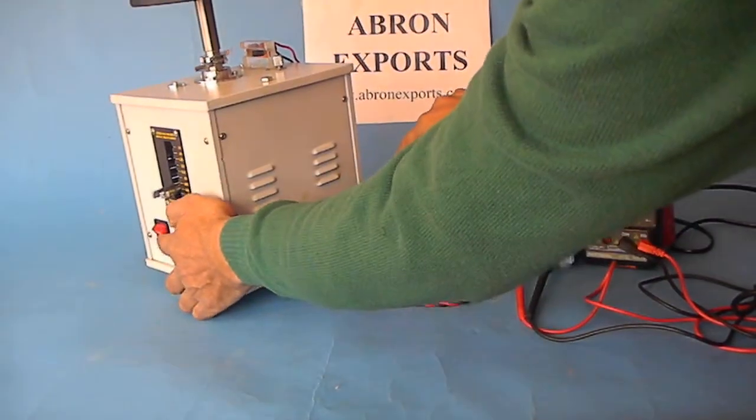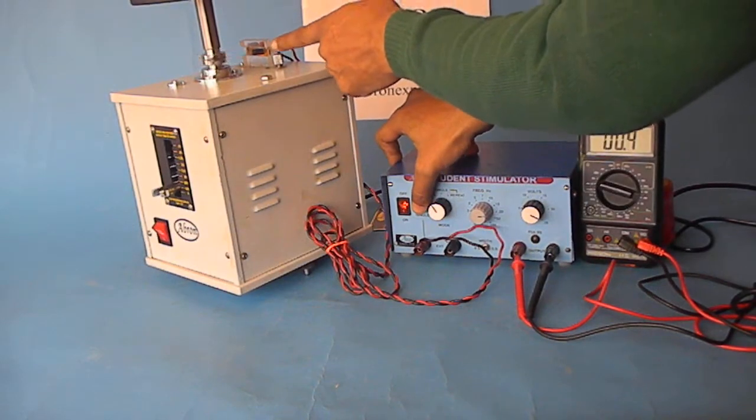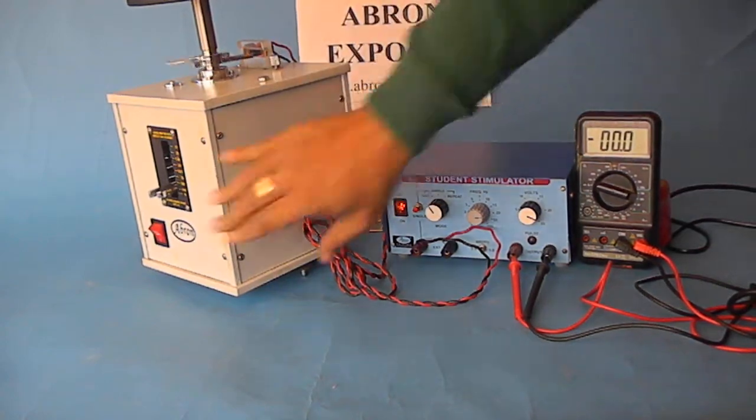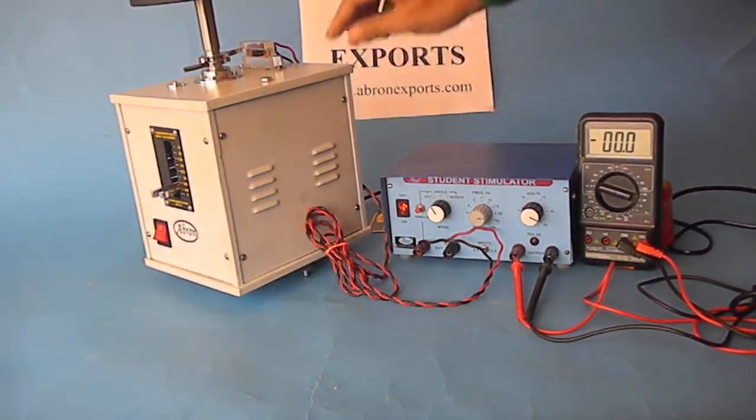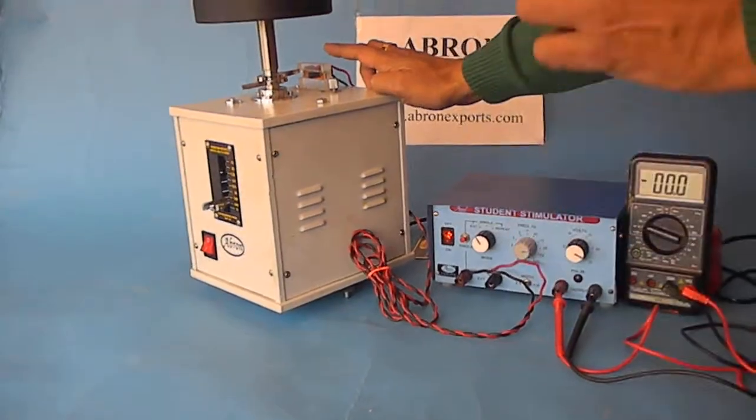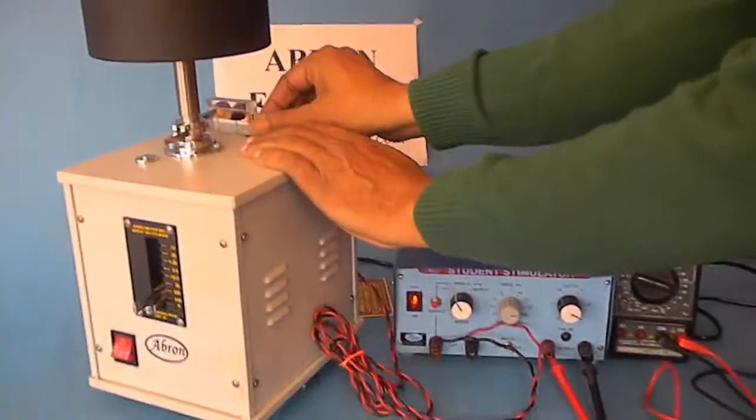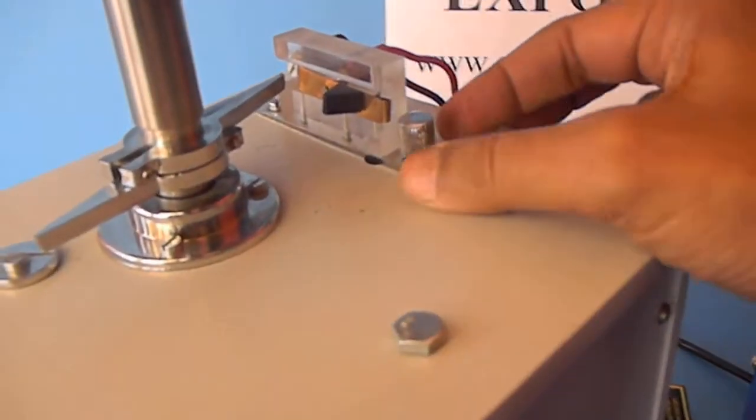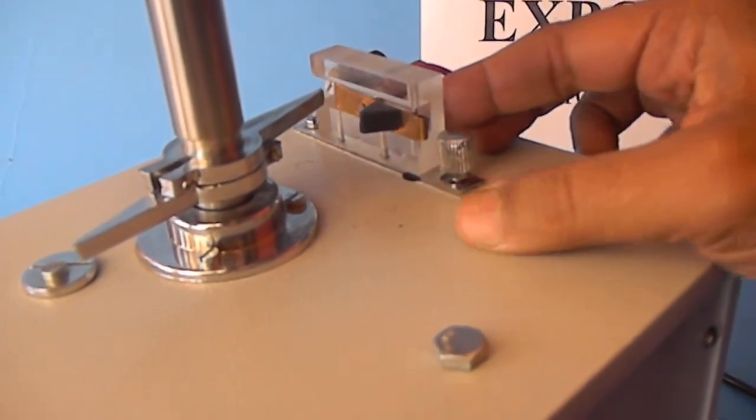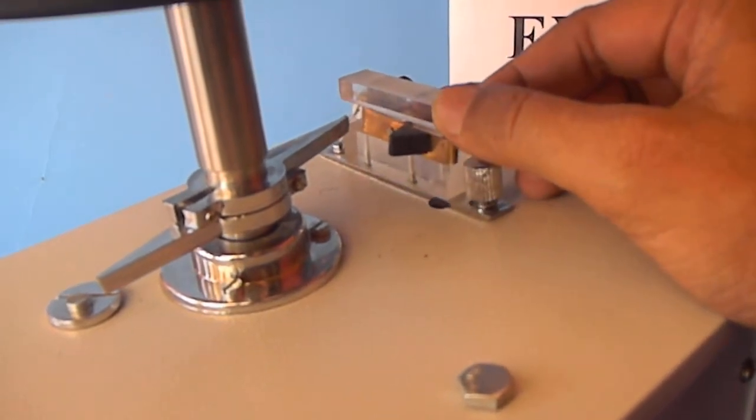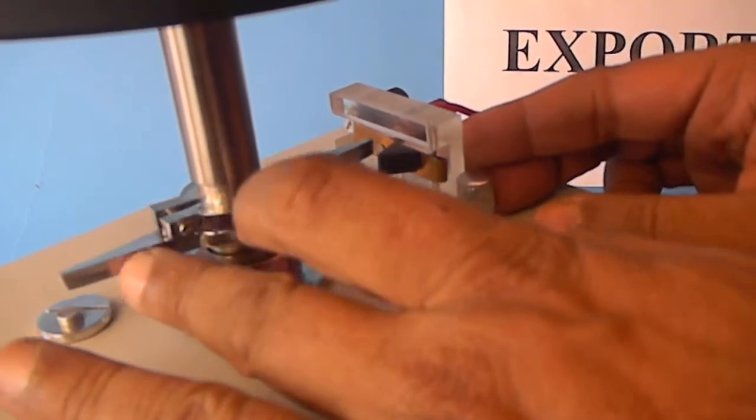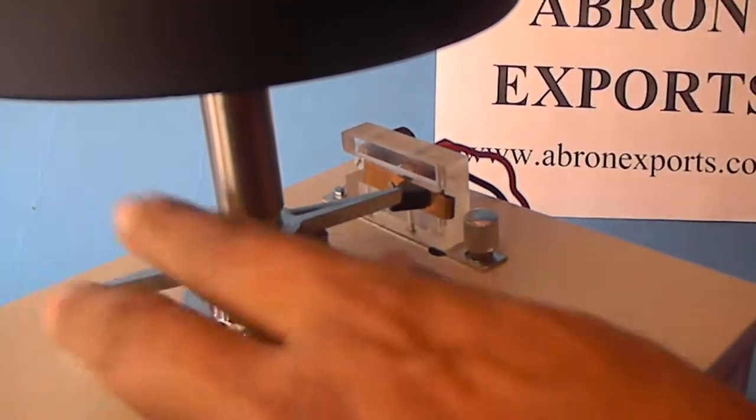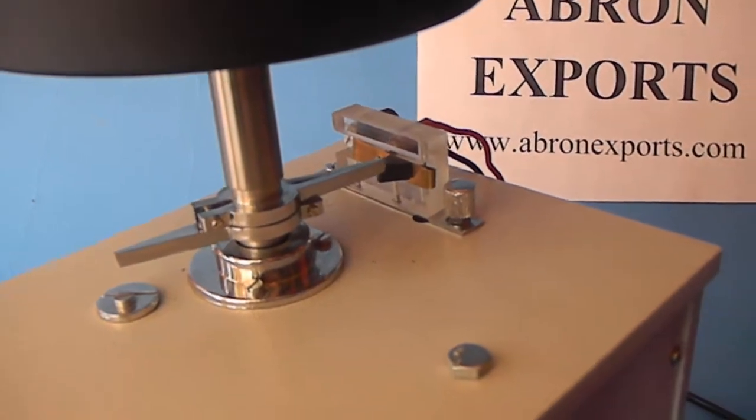Now let us learn how to adjust this pointer. This is a screw - you can adjust this pointer. This part moves, it goes back a little and comes forward. You can see this movement is there, you can adjust so that it touches and lock it here. Now if you move it you can hear the click.